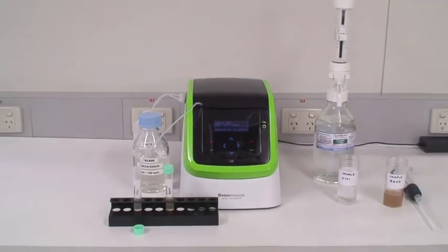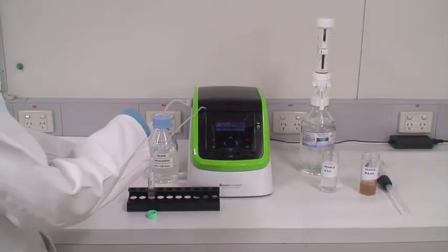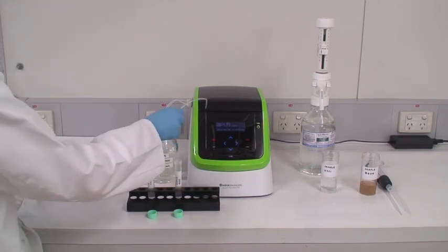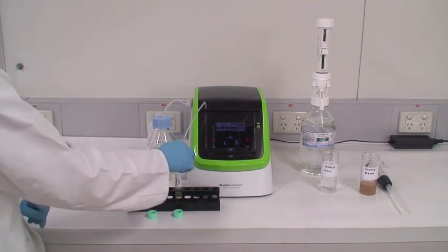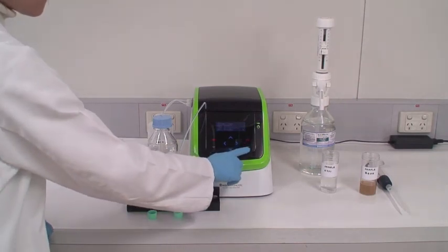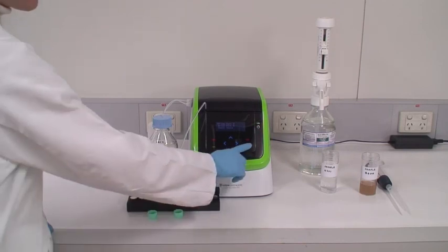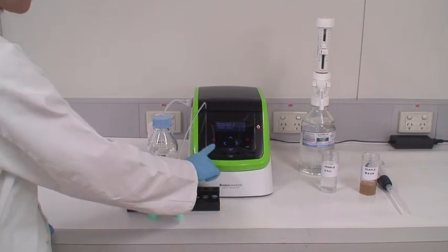Analyzing the next sample. Wipe the tube from port A and place it in the next sample. As before, prime port A twice and then press the Run button. The next sample is now being analyzed.